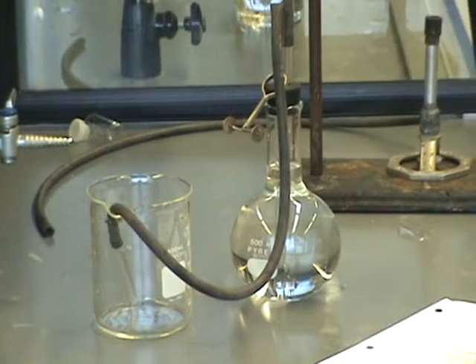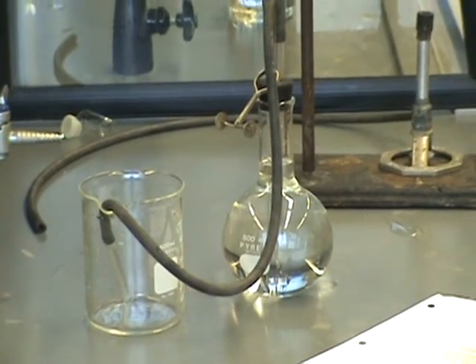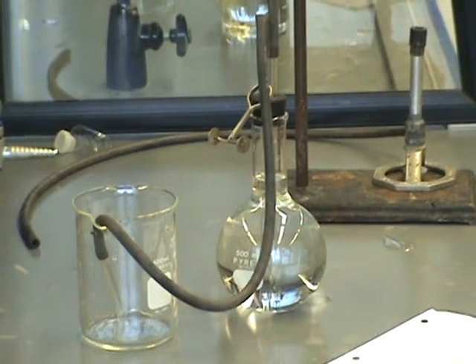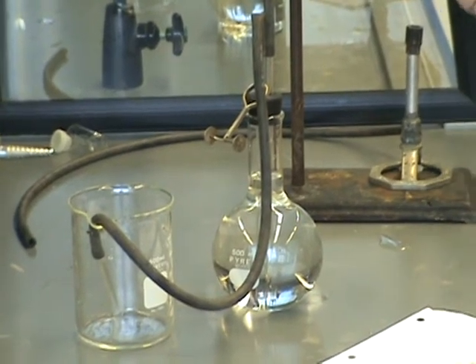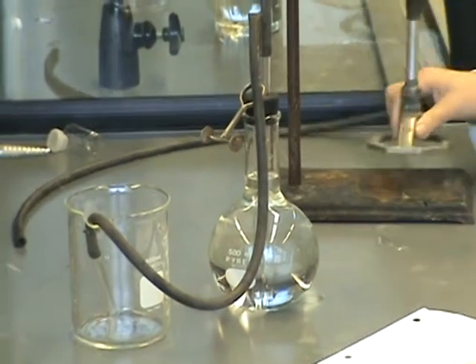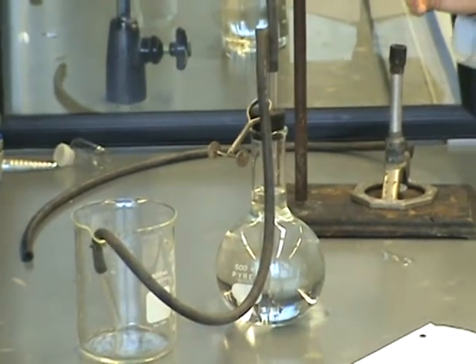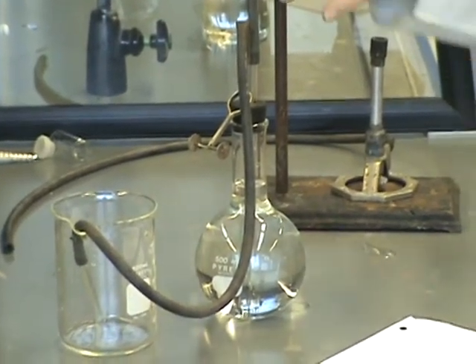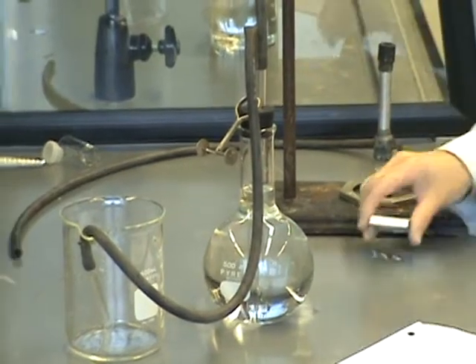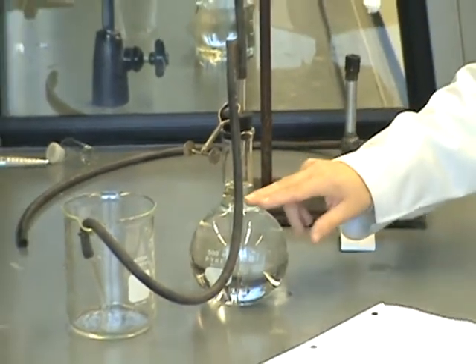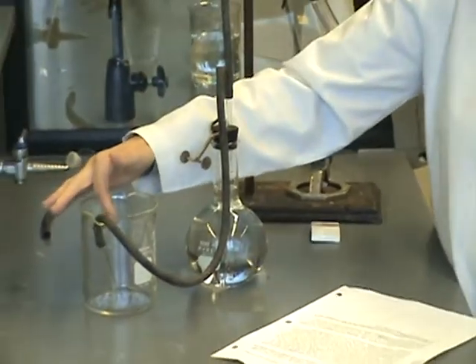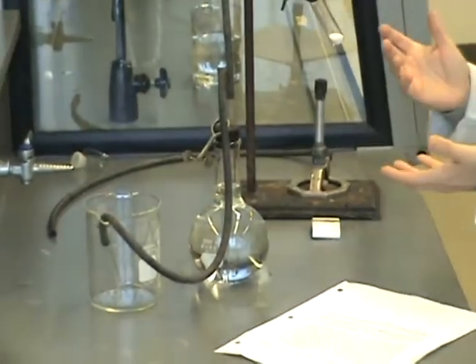Which basically is just heating this. You will actually have this set up inside your fume hood. So, like the Bunsen burner, heat it, move it around like this. You should see the actual oxygen bubbling out of the reaction mixture. The oxygen is going to travel through the tubing and do its thing. You should see the water level in the flask dropping and the water level in the beaker rising as the reaction proceeds.